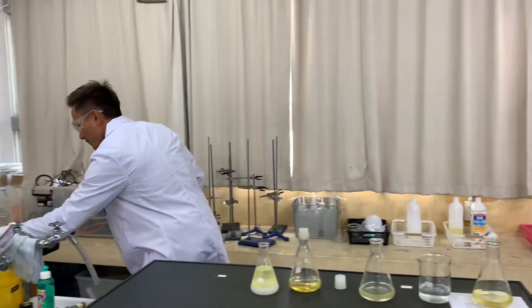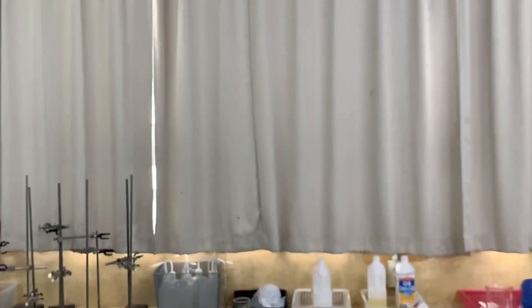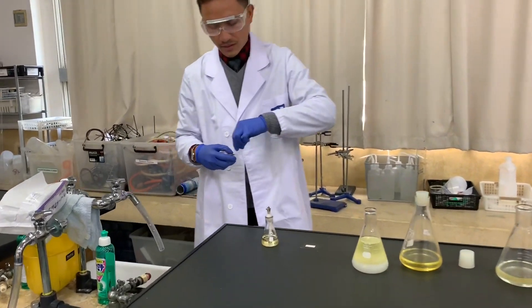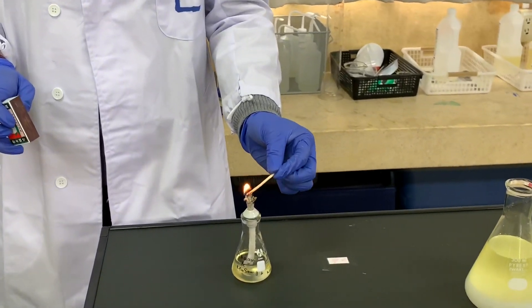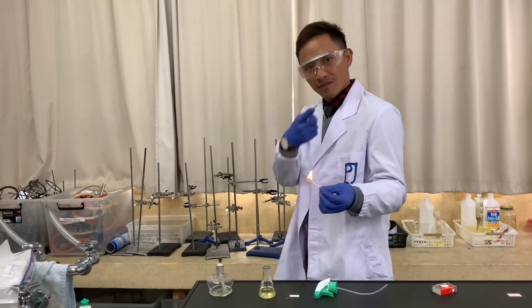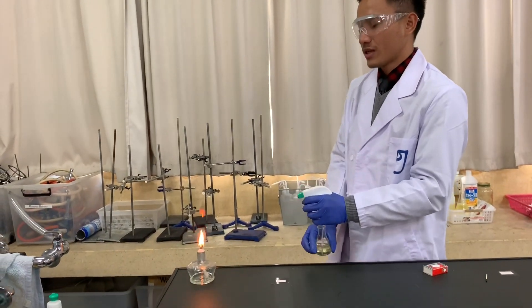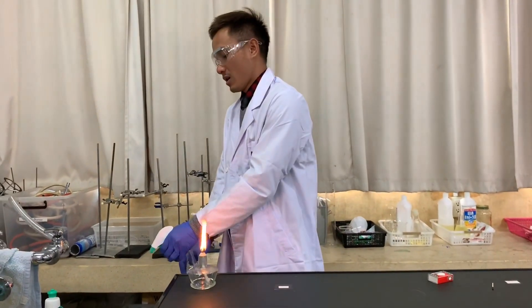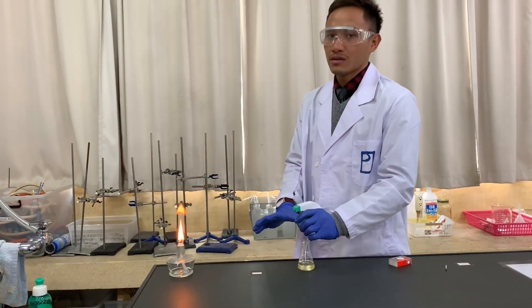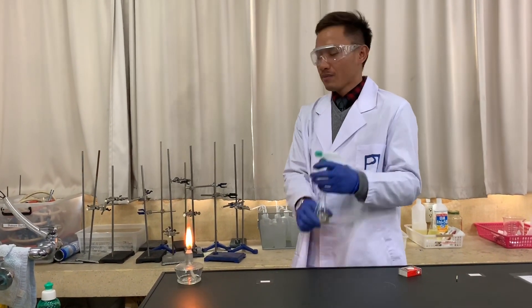This is the clear biodiesel — we can start burning it now. Let's see if it catches fire. There you go — it started. We want to test how big the flame is and what color it produces. Biodiesel is flammable, but like any diesel it has to be vaporized first. So we need a sprayer to vaporize it before burning.